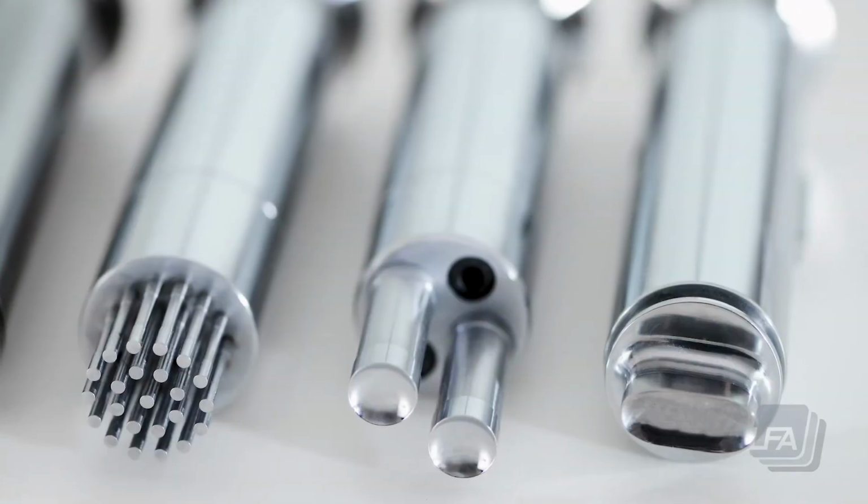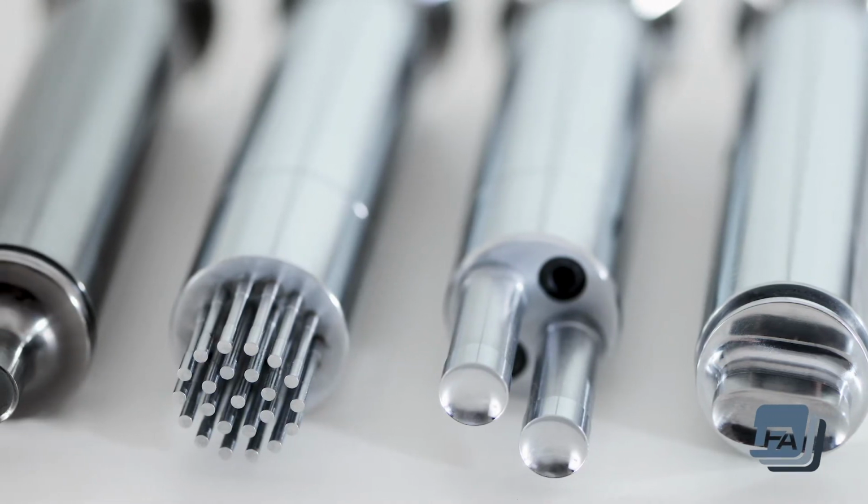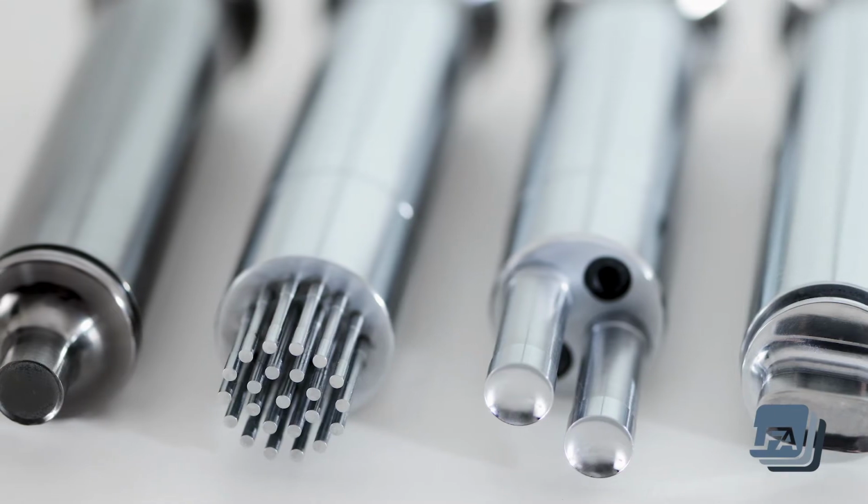Welcome to LFA's video on filling in our custom tooling form. This video will show you how to fill out our custom tooling form and allow us to be able to provide you with a custom tablet design.